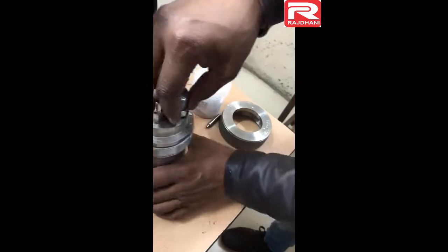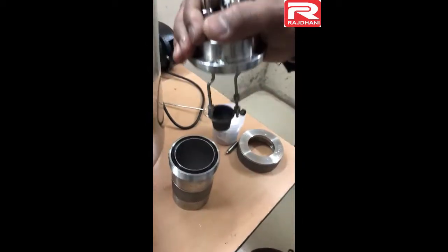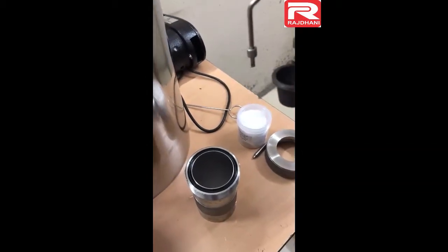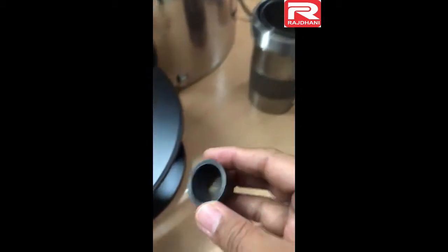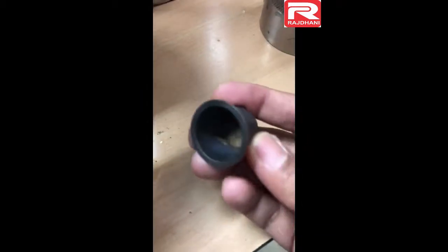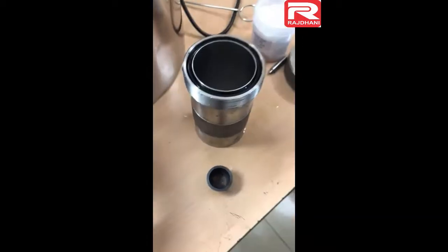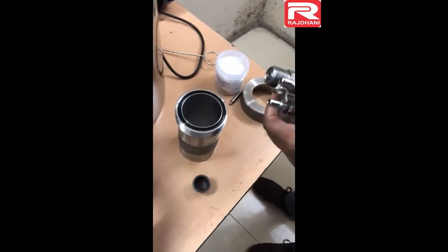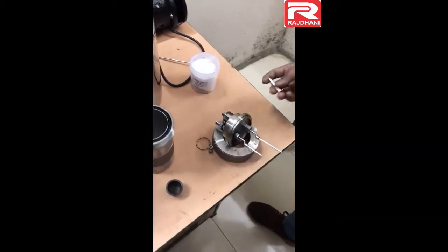Now open the bomb — take the lid up and look at the crucible. You can see there is no sample left, absolutely nothing — 100% complete combustion. This is what is desired. In the case of coal or other samples, some unburnt material may be left, and we have to measure that as well.